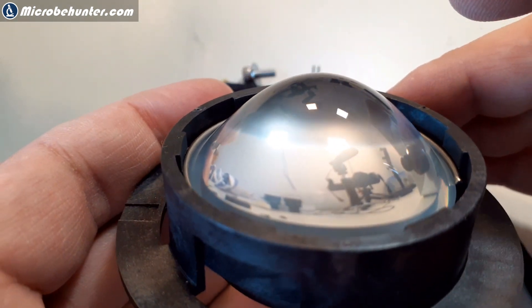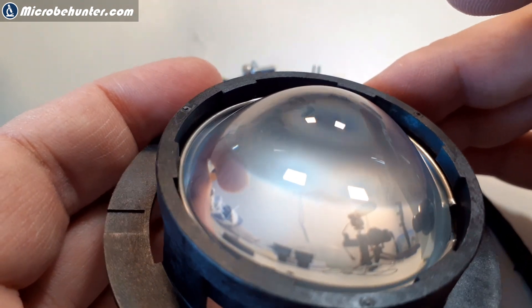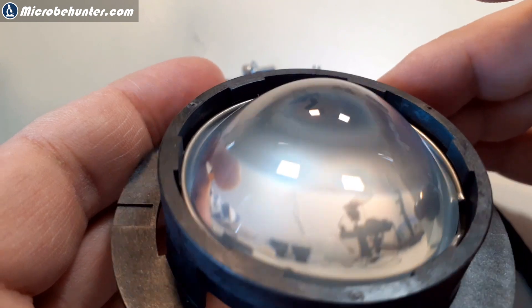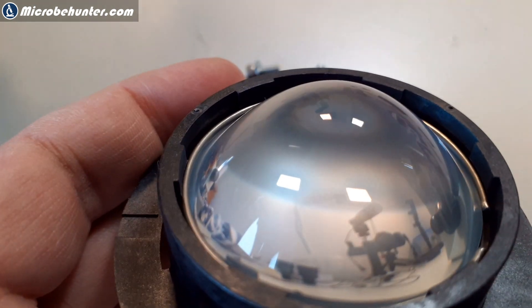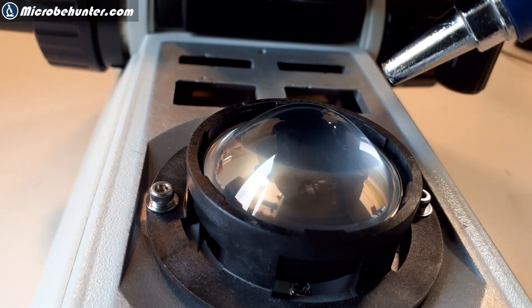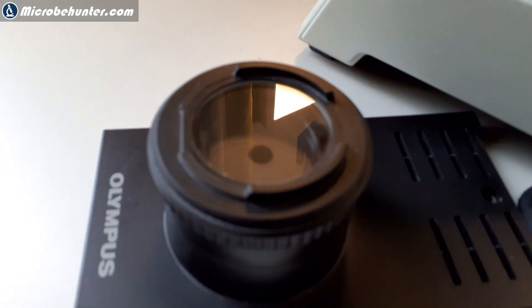But this was actually not really the problem, because it was way too far down and sealed off. So dust particles could not reach this place. But there were other parts as well. I gave it a cleaning with compressed air in any case. But this was actually the problem part.